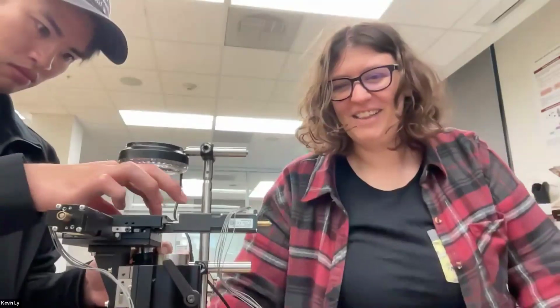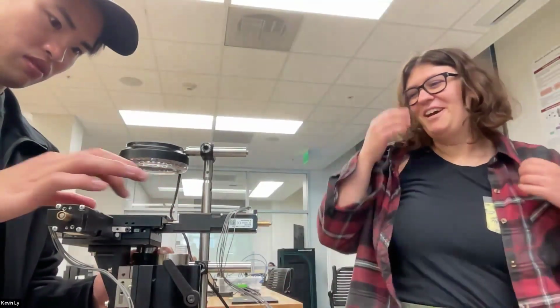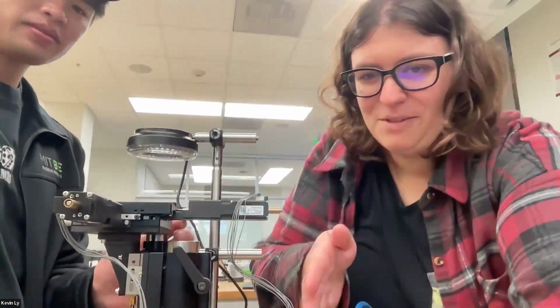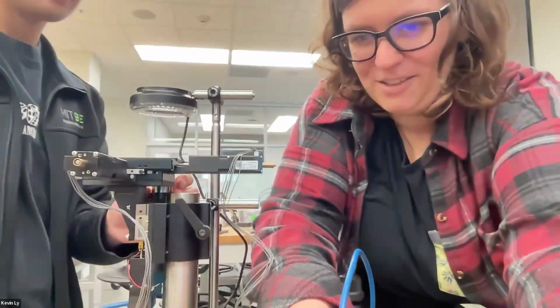Microscopy has a lot of jargon, and everybody may not have used a microscope. This is an intense introduction to microscopy, I think. So just let me know if there's anything I don't define that doesn't make sense. So maybe just a little more basics while Kevin is screwing on this objective here.